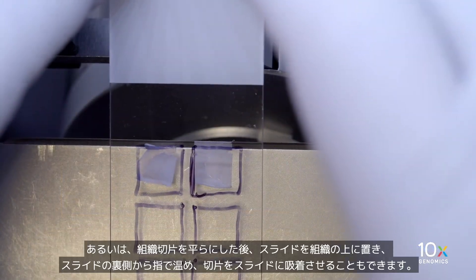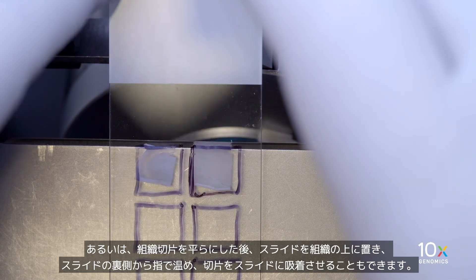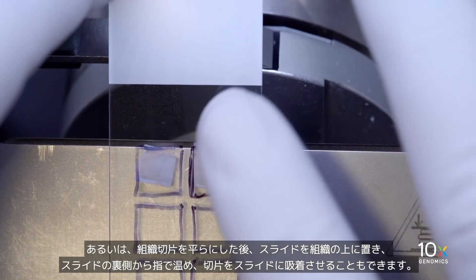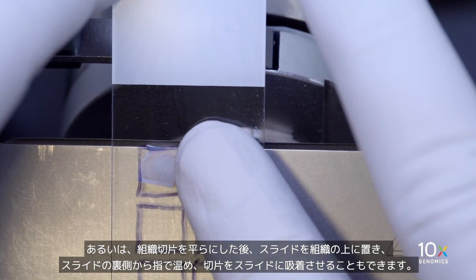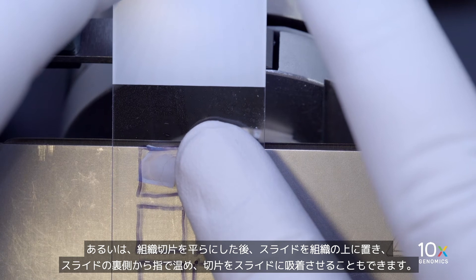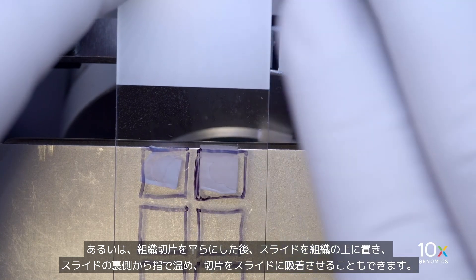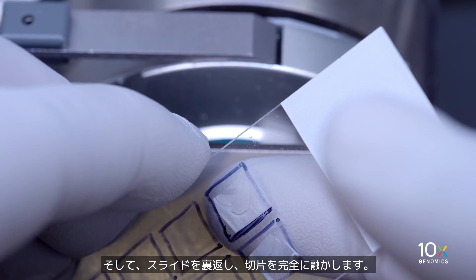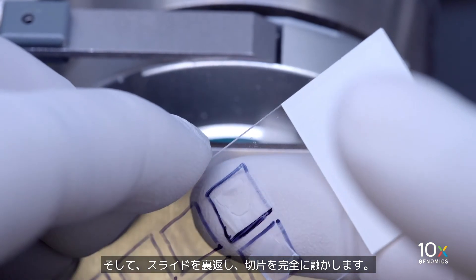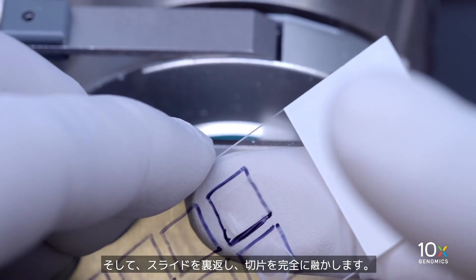Alternatively, after flattening your tissue section, you can bring the slide above the tissue and warm the square on the backside of the slide with your finger, as this will help attract the section to the slide. Then, flip the slide over and complete the melting of the section to the slide.